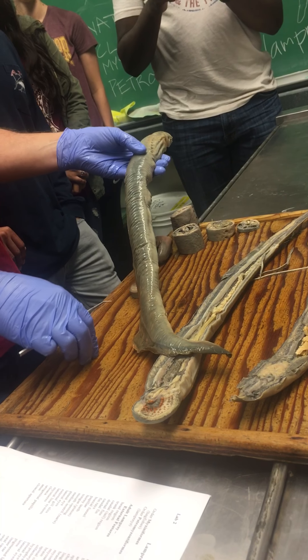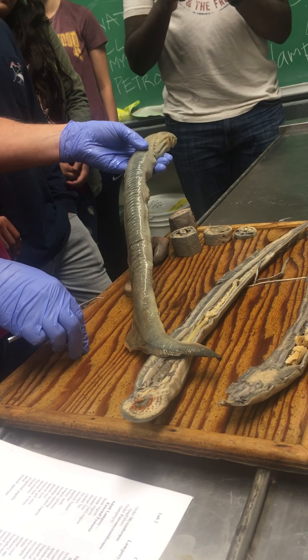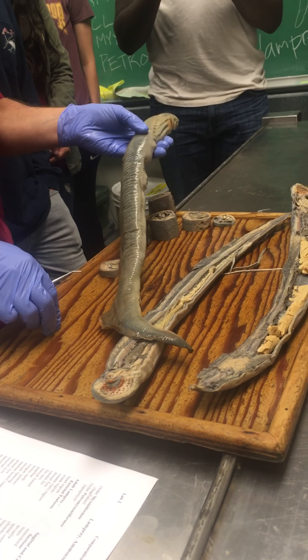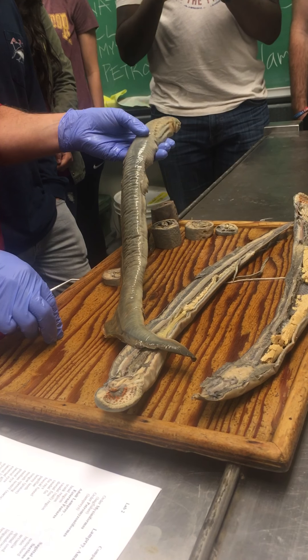Where does the tail region start? The cloaca. So everything behind the cloaca is the tail — the post-anal tail.